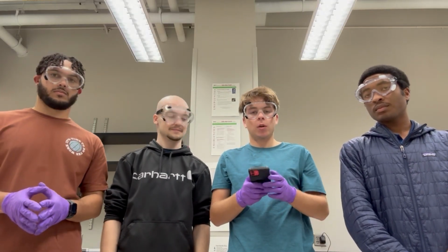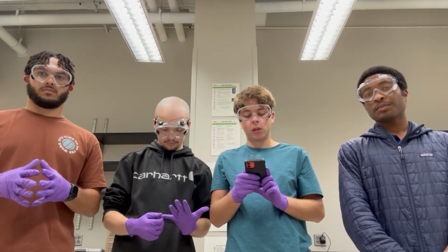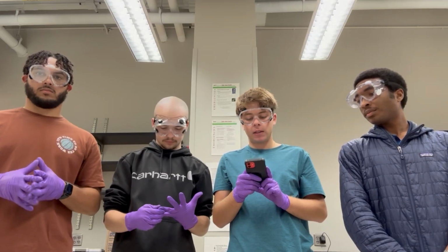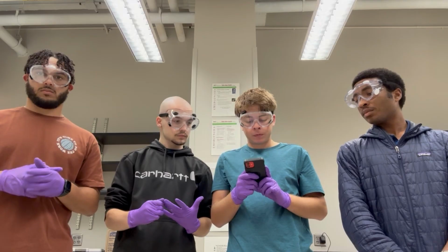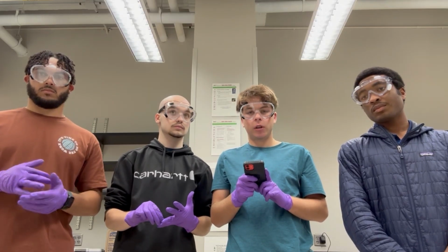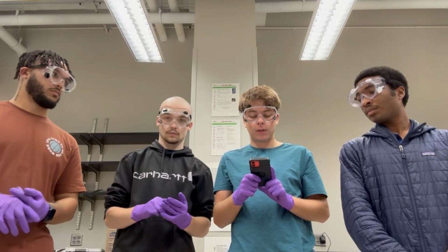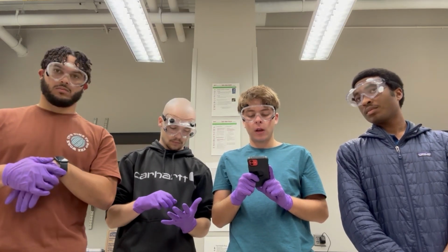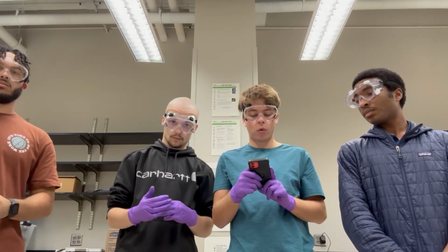So the relationship between absorbance and concentration is a direct proportionality. The Beer-Lambert law establishes a linear direct relationship between A and c, provided the path length and molar absorptivity are constant. So this means that doubling the concentration will result in doubling the absorbance. This linear relationship allows scientists to create a standard curve using known standards, which is then used to determine the concentration of an unknown sample.